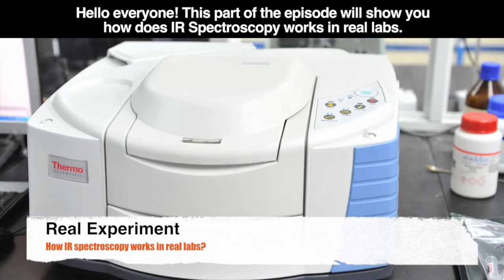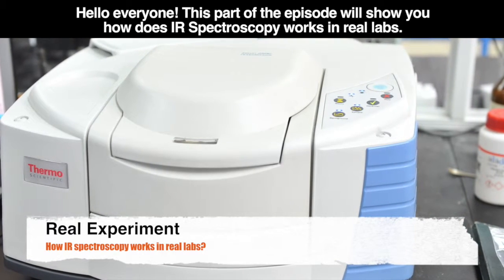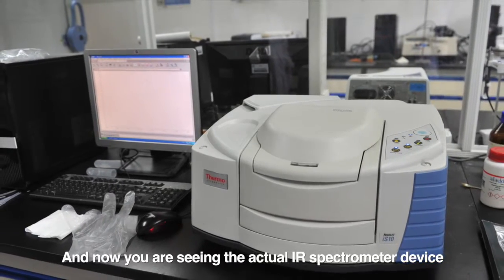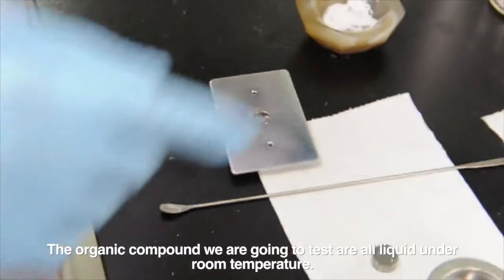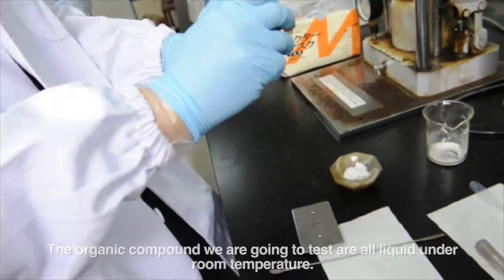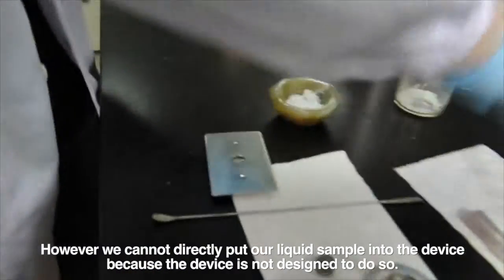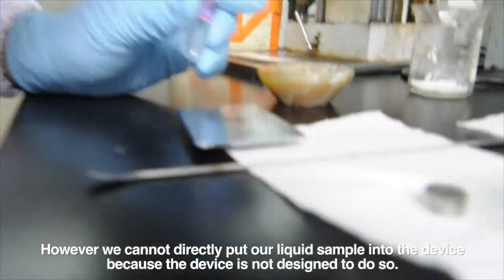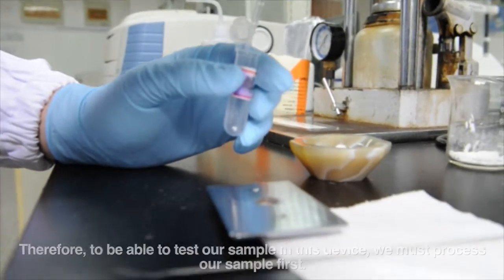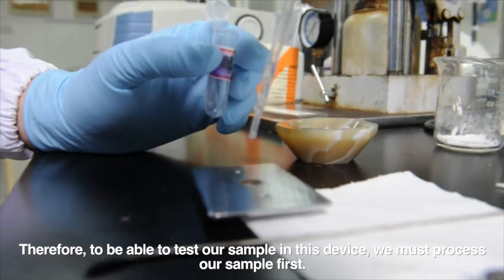Hello everyone. This part of the episode will show you how IR spectroscopy works in real labs. And now you are seeing the actual IR spectrometer device. The organic compounds we are going to test are all liquid at room temperature. However, we cannot directly put our liquid sample into the device because the device is not designed to do so. It is designed to test solid objects. Therefore, to be able to test our sample in this device, we must process our sample first.